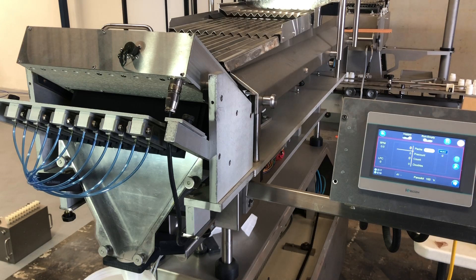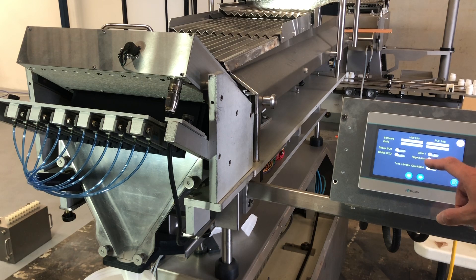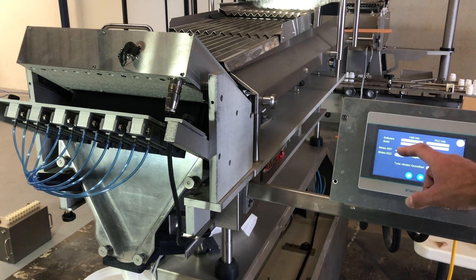So this is how it would run on an actual counter — this one is a bit different from your one but it's still relatively similar. So the gate test — this is the indexing gate. Well, this machine has a reject arm. But the slide sequence, the slide sequence two — they will go much faster.